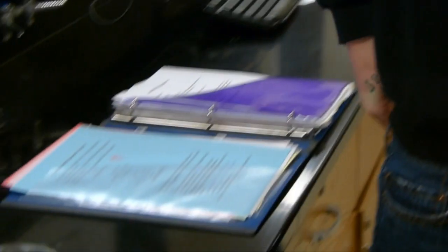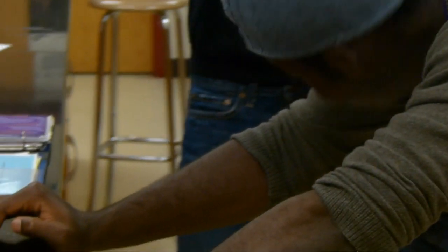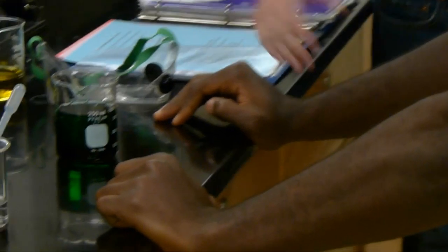You wanna bet? I double dog dare you won't drink this. You wanna bet? Yes, like, I have money in my pocket, I swear to God. You won't drink this right now. Alright, you bet. Drink it. Got this. It's not even that much. Come on.